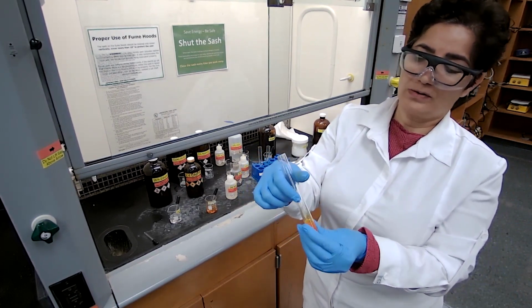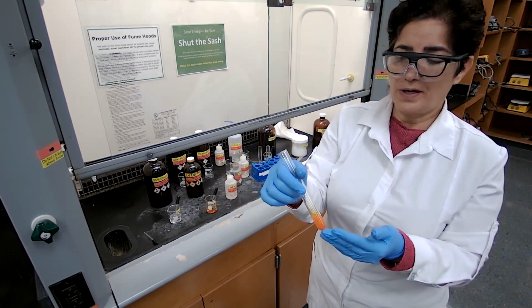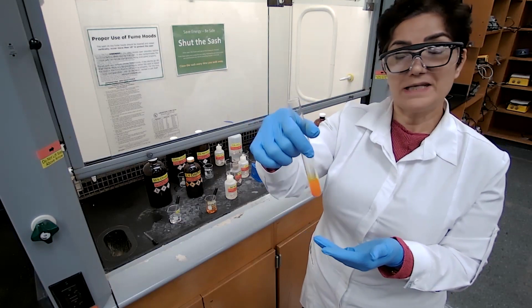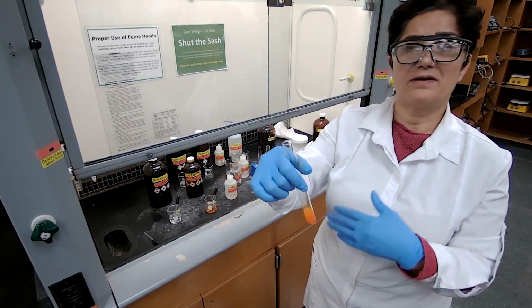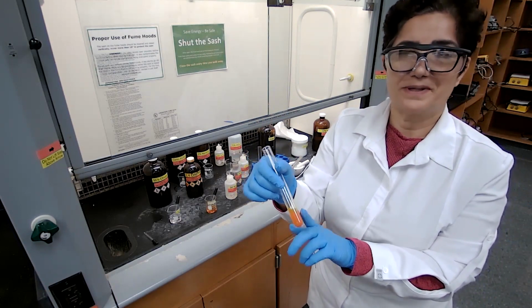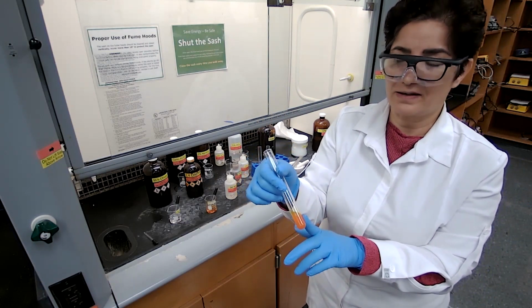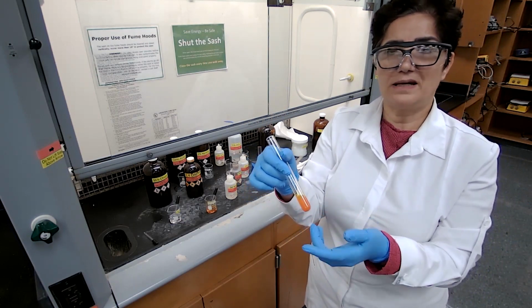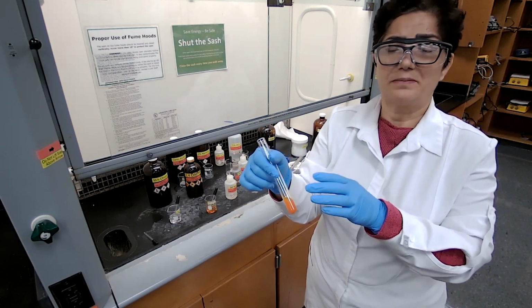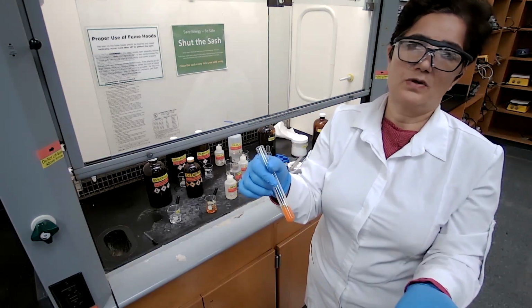So to distinguish between the ketones that have a melting point between 40 and 50, we are using the derivative of the ketone and measuring the melting point of the derivatized product. The derivatized product is the yellow precipitate we have here, yellow to orange. In this case, it is the orange precipitate. The table provided in the lab manual shows the melting points for several ketones and the melting points for the 2,4-dinitro derivatives of those ketones.